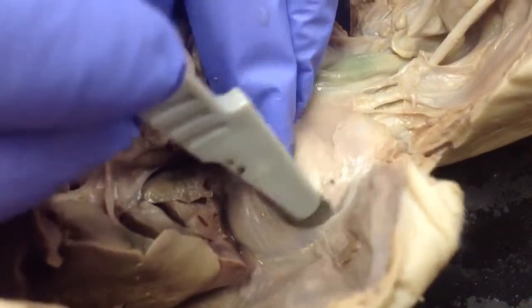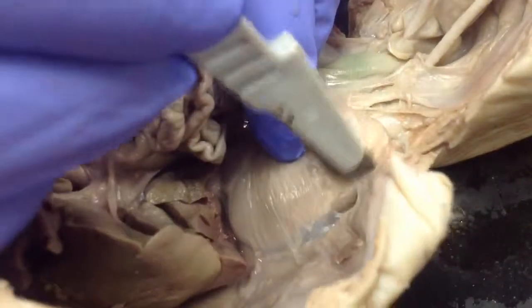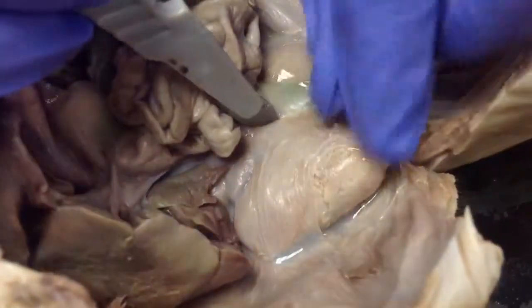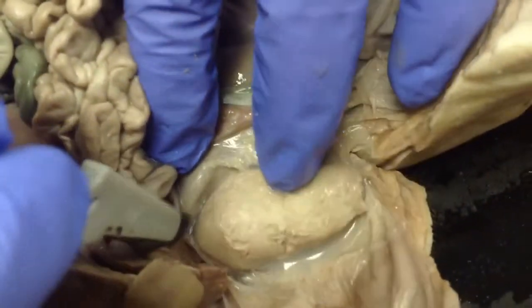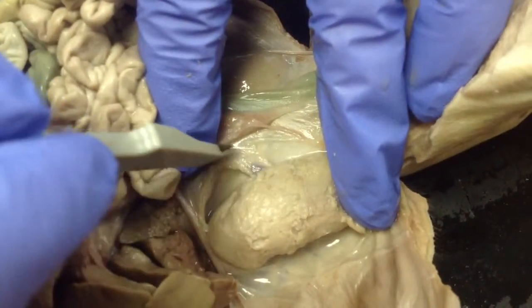Okay, that's the... Oh, here we go. Let's just slice through that skin to kind of free up that kidney a little bit more. We'll pull that skin back. And you can see there's the kidney. It's free. It's held together by arteries and veins that connect it straight into the circulatory system.